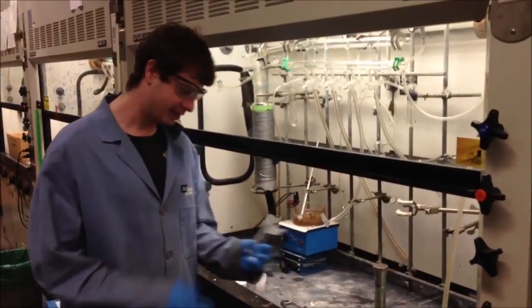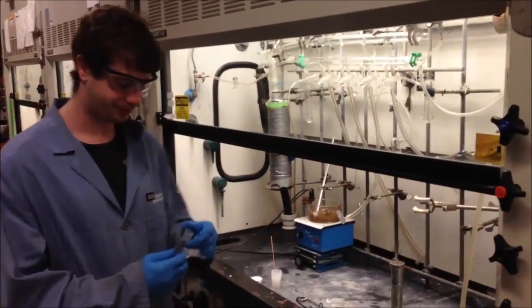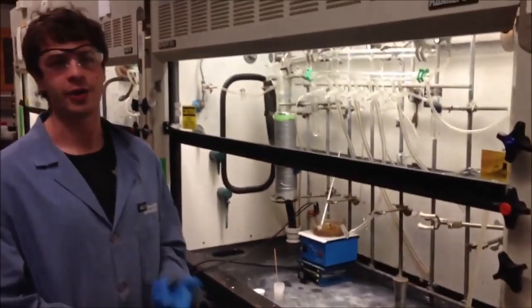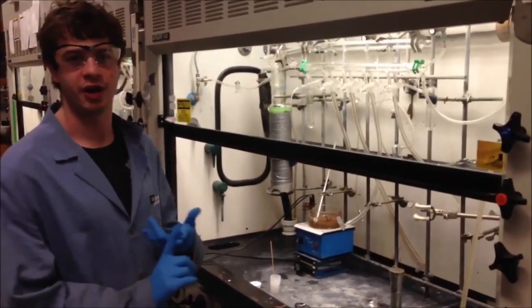So it all starts with this piece of glassware, which is a Schlenk tube. Because the reaction is very water sensitive, we need to make sure that there is no air and no moisture on the glassware.